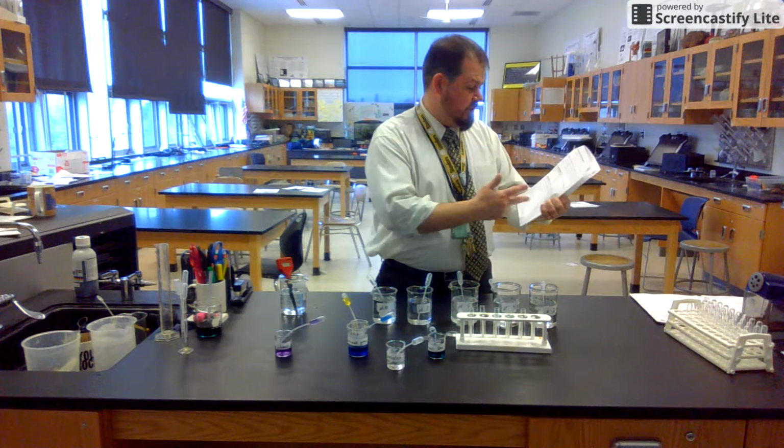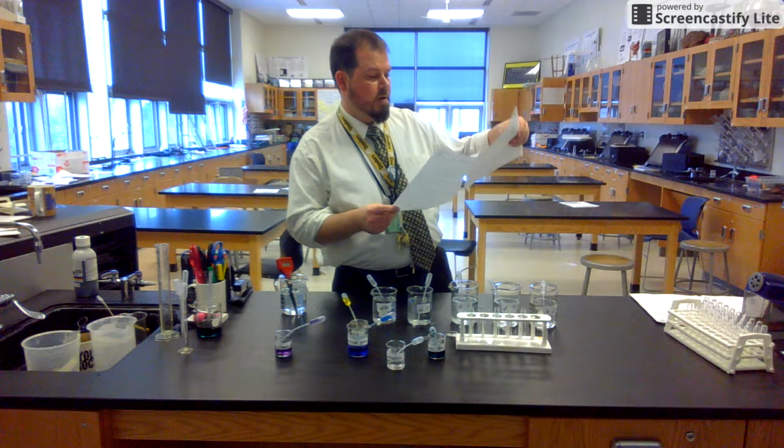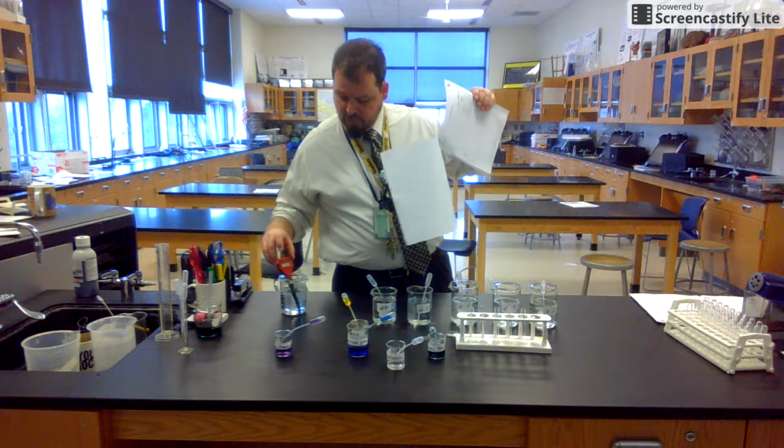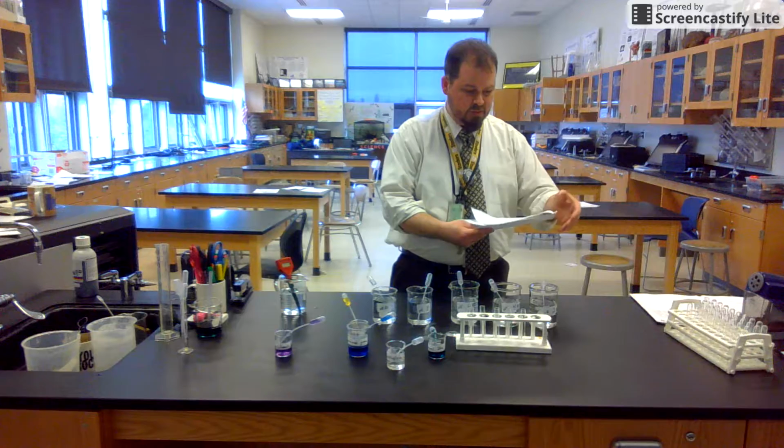Data and evidence interpretation. Talk about the pH values that we got from our pH reading and being able to turn those into concentrations. And that is pretty much the lab. This should be pretty quick and easy.